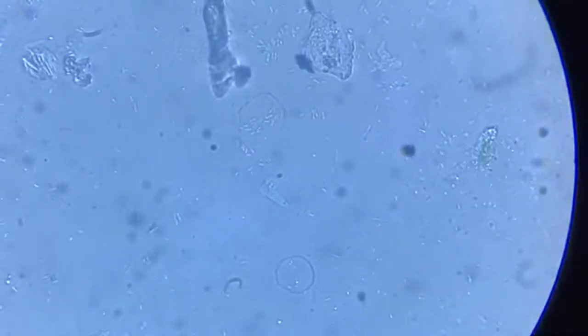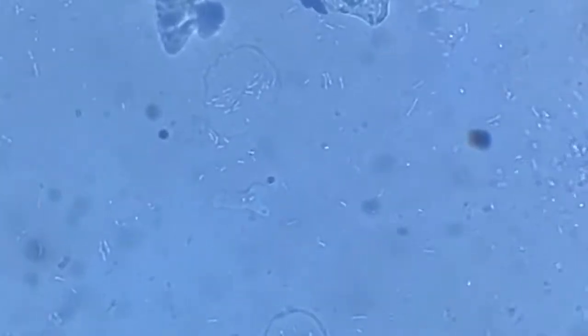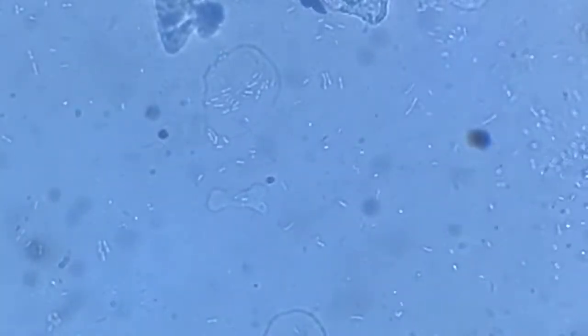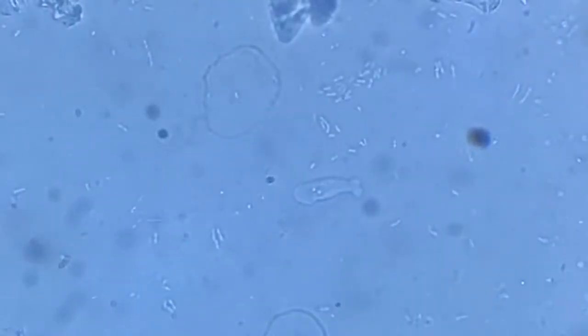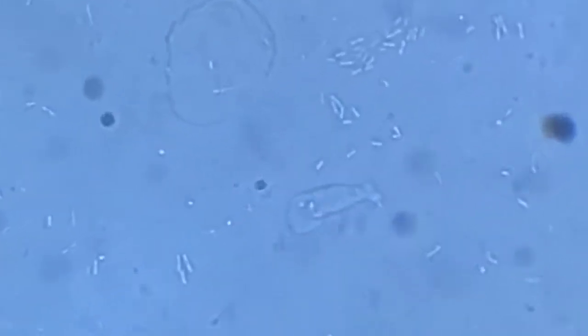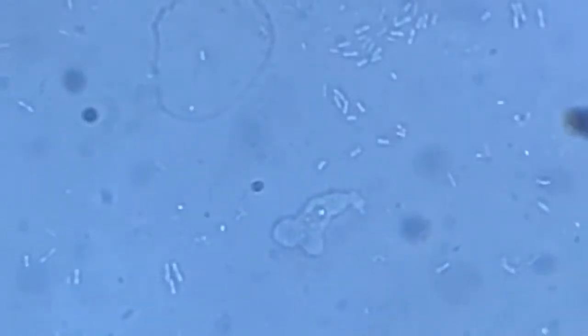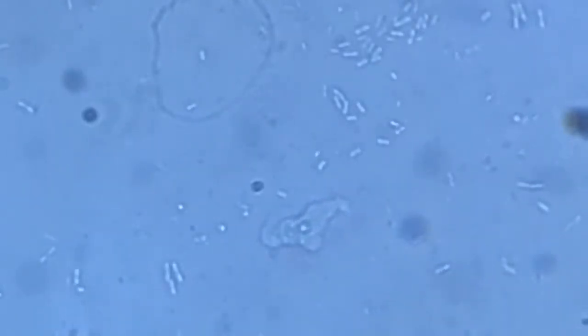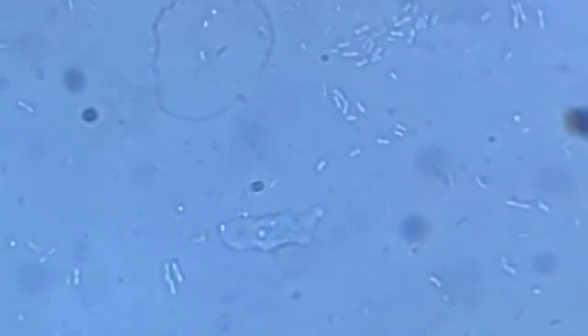So we'll just focus on one or a few amoeba and then call it off. Let's focus on this fellow, assuming the shape of a torpedo. Now a whale with big eyes. Now just a floating mass of gel.